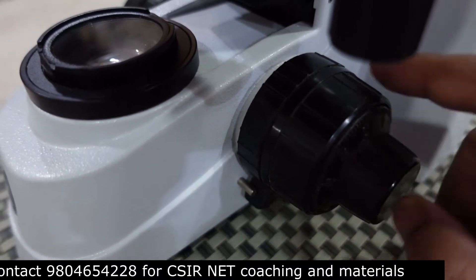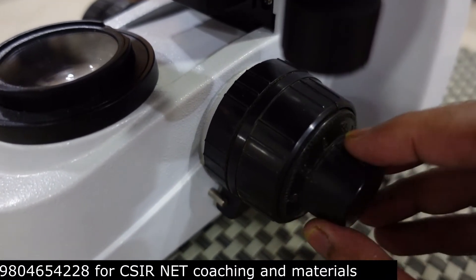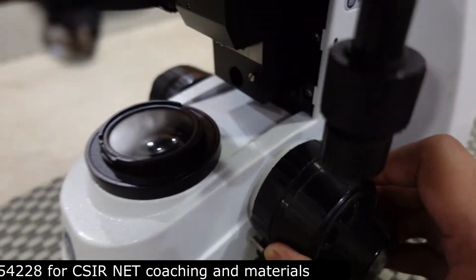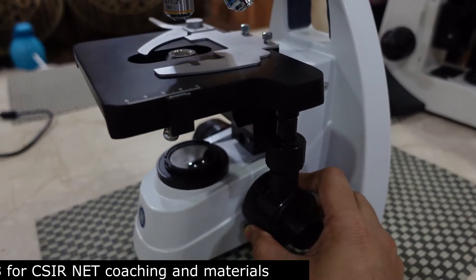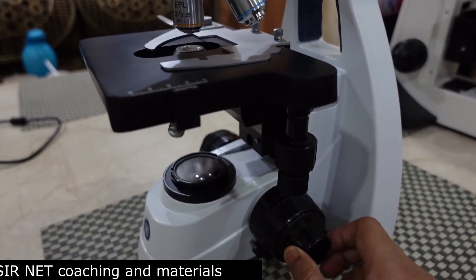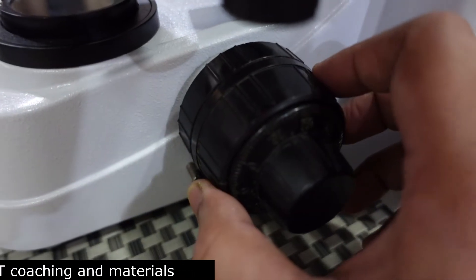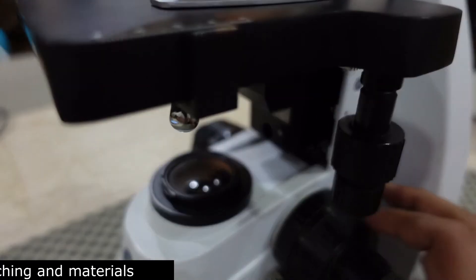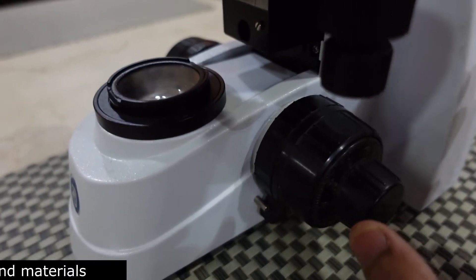The second component is the focus knob. There are two parts — the large one is the coarse focus adjustment screw, which moves the stage up and down visibly. The fine adjustment also moves the stage up or down but only by a very small amount. Always first adjust with the coarse, then use the fine adjustment.